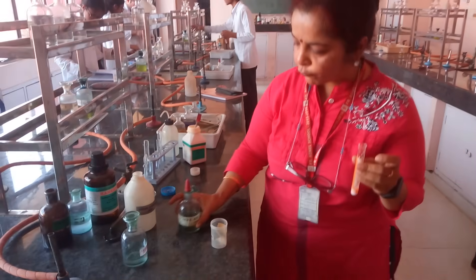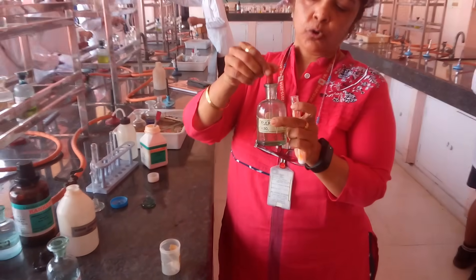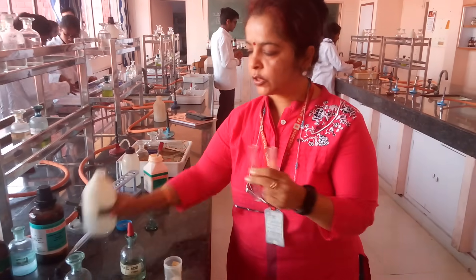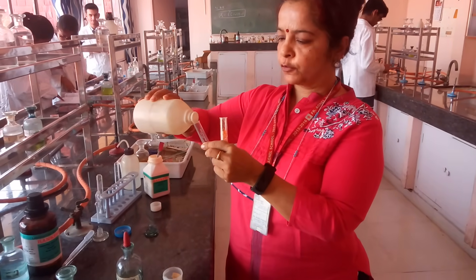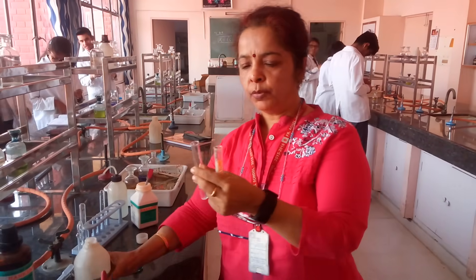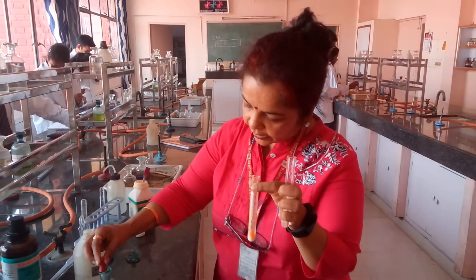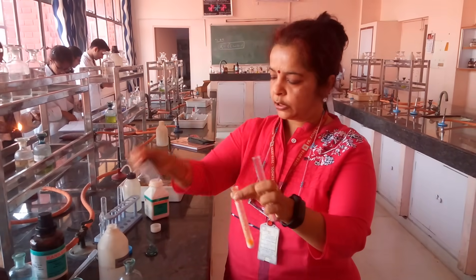Before the addition of concentrated sulfuric acid, which is to be done through a dropper — note it as a corrosive acid. You need to use another test tube and fill it with sodium hydroxide. I am taking around 2-3 ml of sodium hydroxide in another test tube, and I will be generating the chromyl chloride gas in the first test tube by adding concentrated sulfuric acid to it.